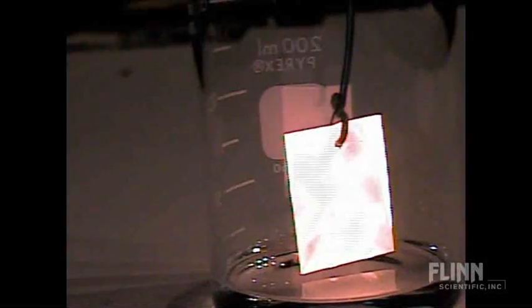And I just absolutely love that. It is so hot that it will continue to do this until that acetone is gone. It'll just be in there just shimmering. And what you see, that shimmer you're seeing, is the reaction going over the surface where it just starts to oxidize and then it can't because it's so hot. And it's absolutely just bright, bright, bright.